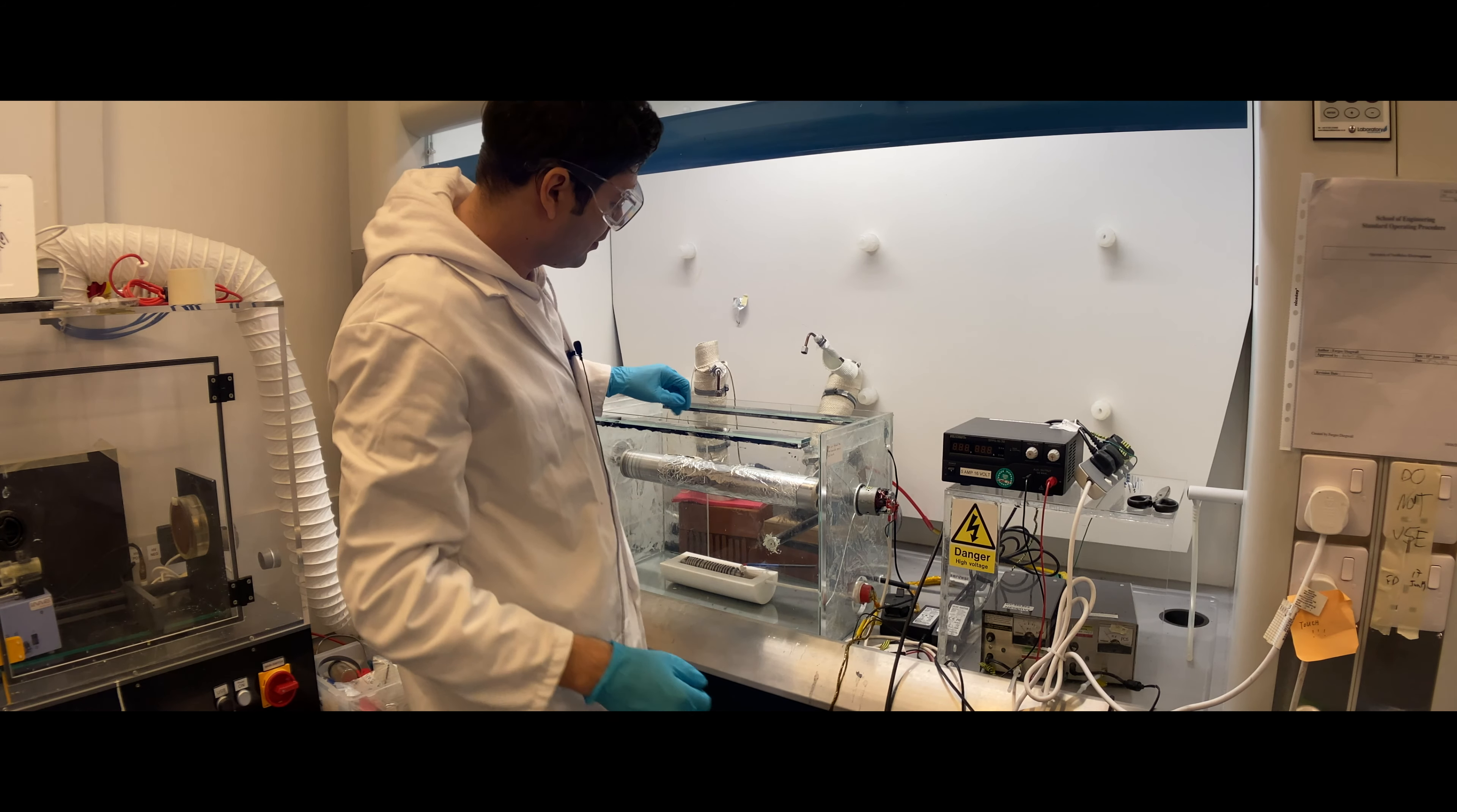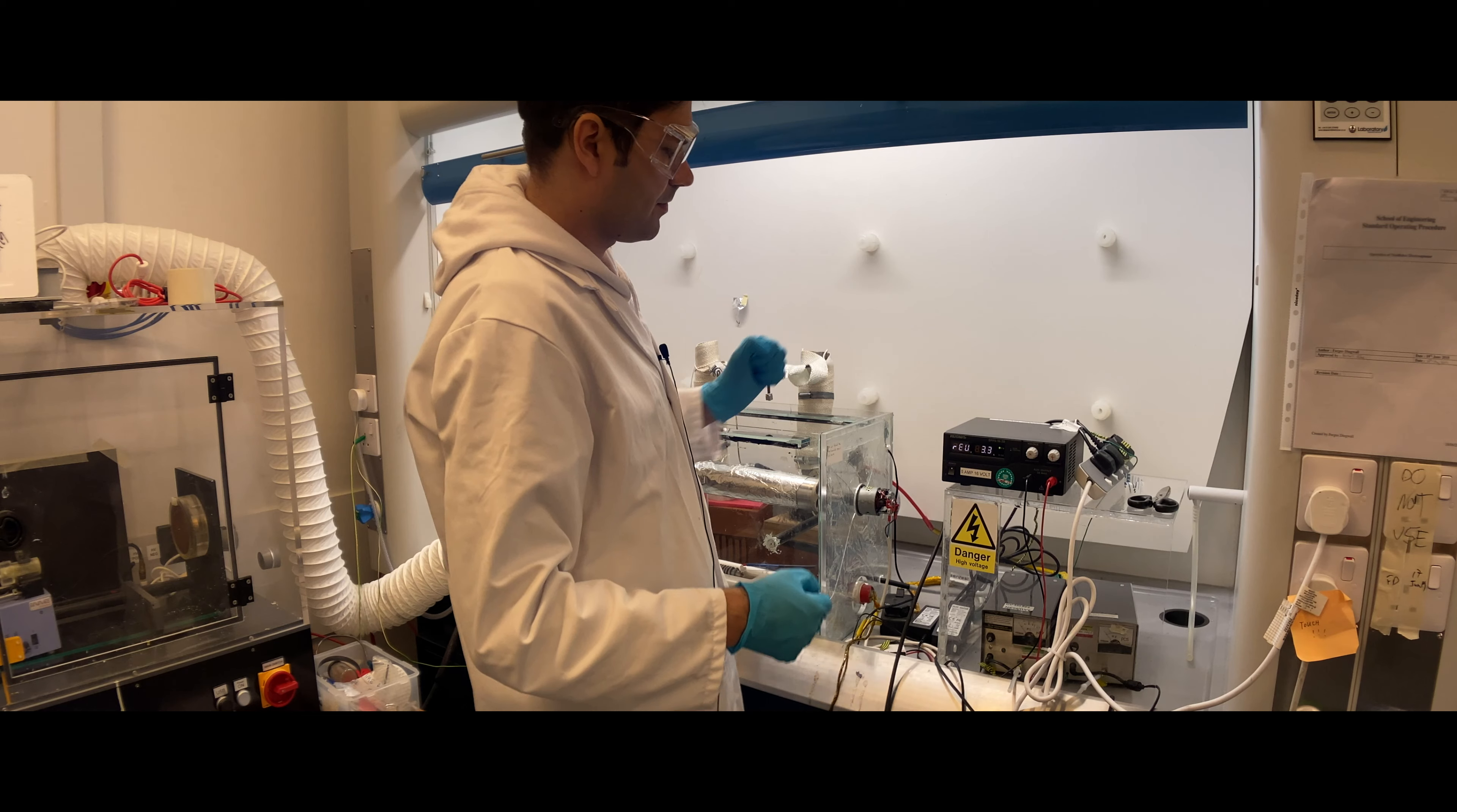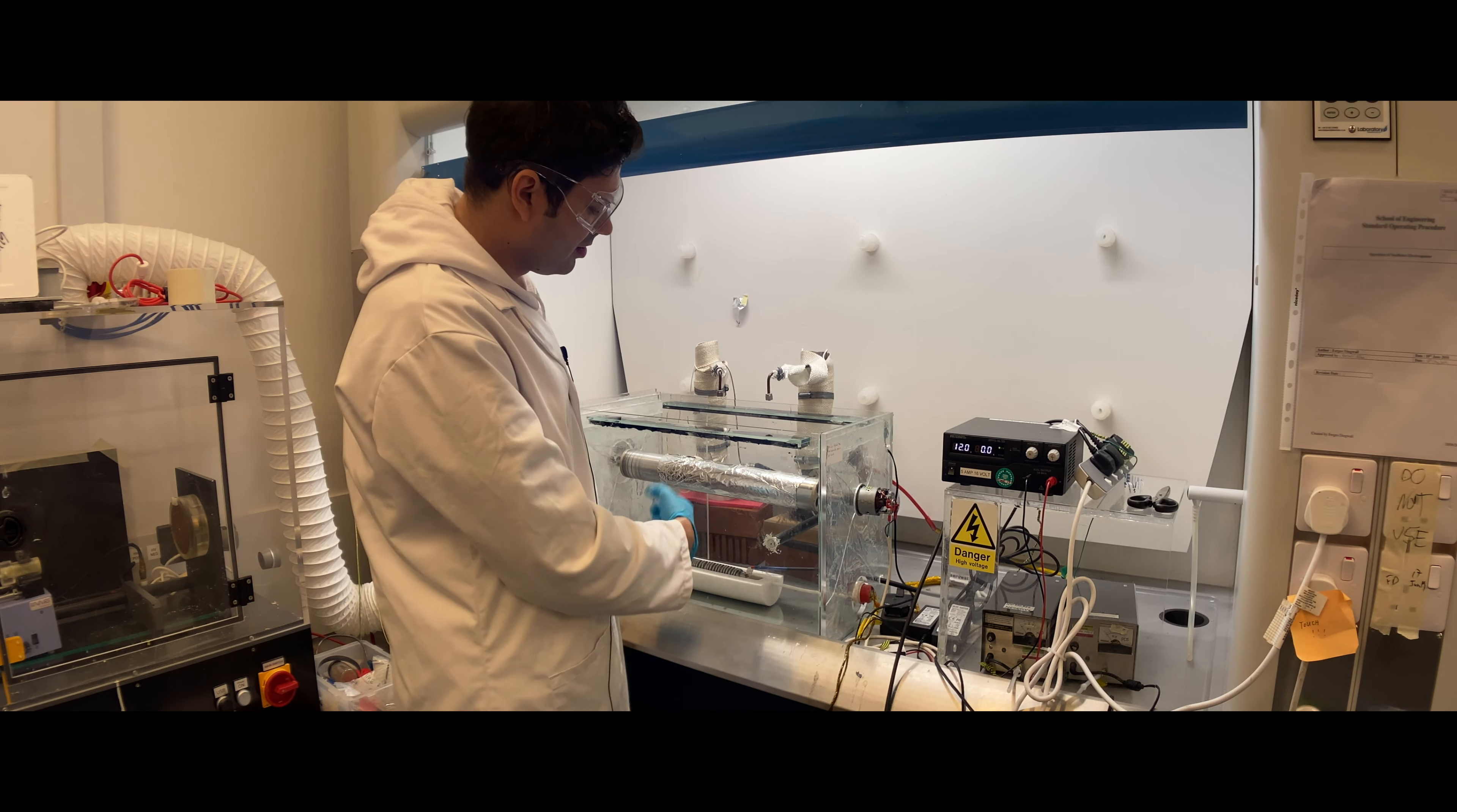Once this is done, you can turn the system on. You should check whether the electrode is rotating and whether the high voltage loop is touching the metal part of the electrode correctly. You can turn on all the electronics simply by turning on these switches. You can hear now and see that it's rotating, and you can see whether the connection to the DC motor by the Teflon rod is okay. If you can see it's revolving slowly, then it's working fine. Now we're done with the bottom part. The high voltage is connected, the DC motor is connected, the electrode is rotating.